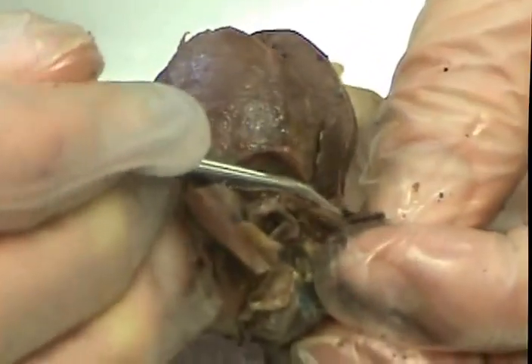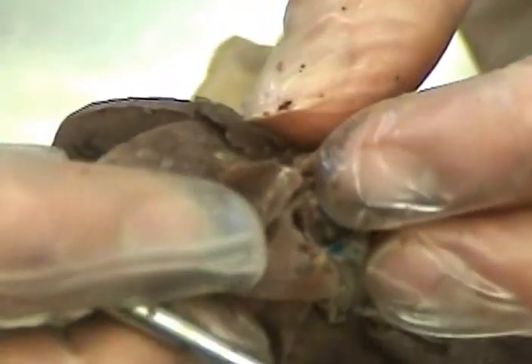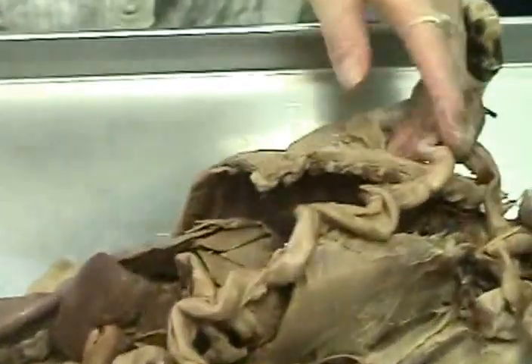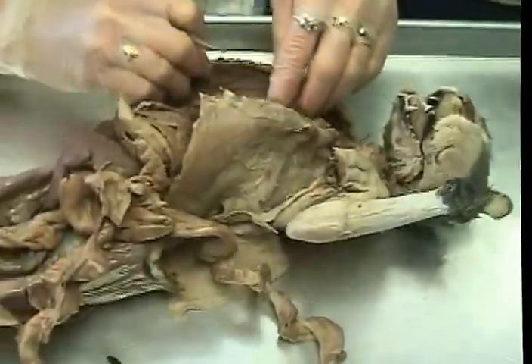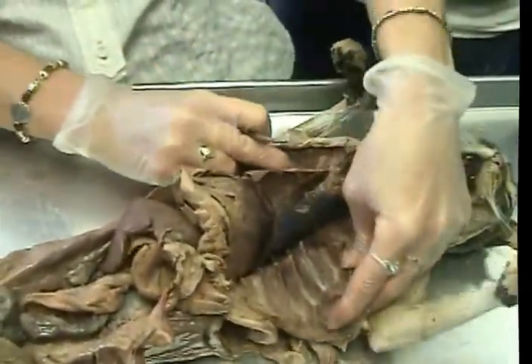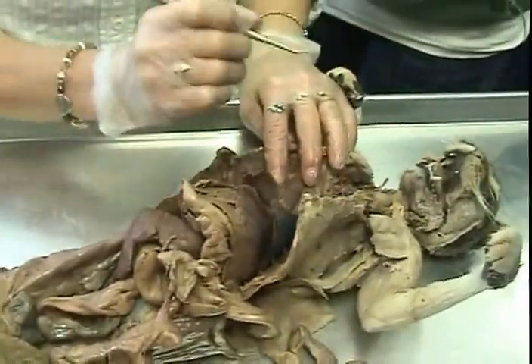You're going to have to cut that out. Right in there. It's weird how flat that one is. I think that's it. Okay? Okay, kitty time. Upper stuff. No. Oh, the cat's touching my shoe. Sorry. It's not going to be in the video. This is really dissected well, and you can see everything. You are welcome. I like this cat a lot.